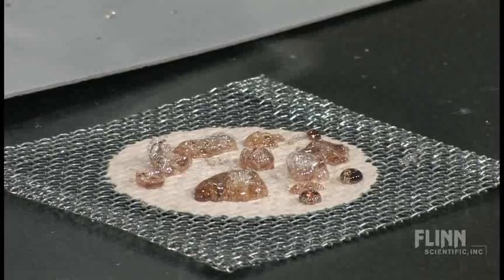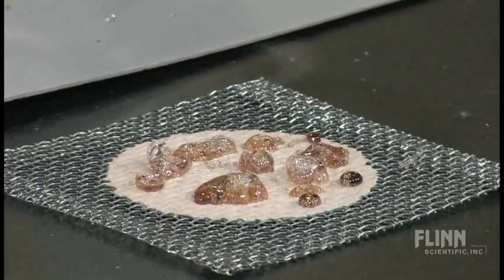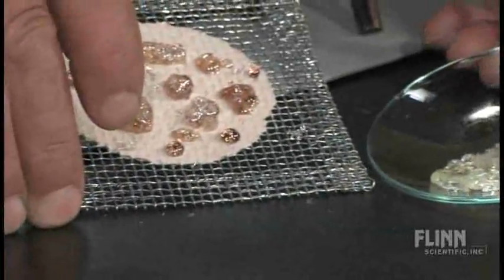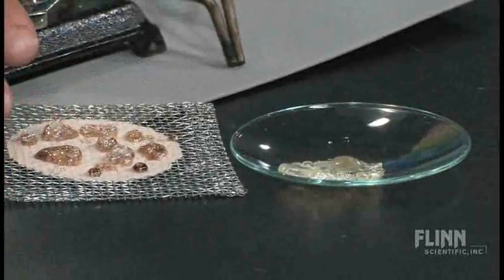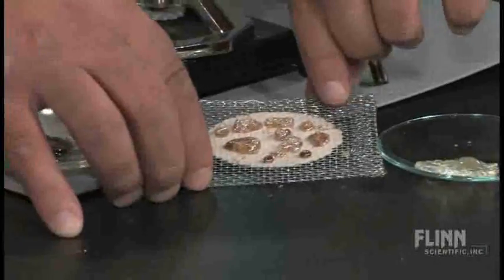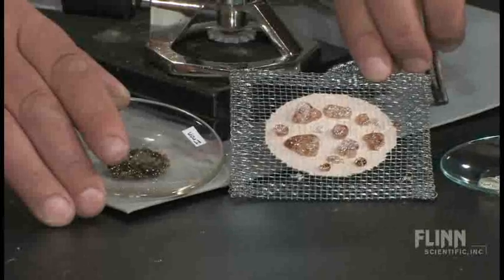It's still a little warm probably. I don't want to pick it up just yet, but I'll bring the plain glass over to it, and you can see that the manganese did color it. And if I bring the iron over, I've made a different color again. And when this cools, it'll deepen, and it might even be a little darker. Thank you.